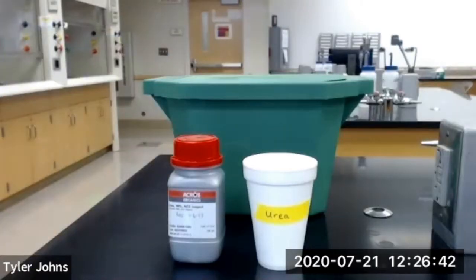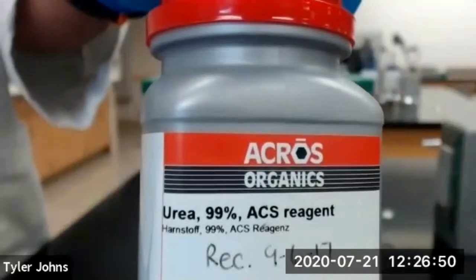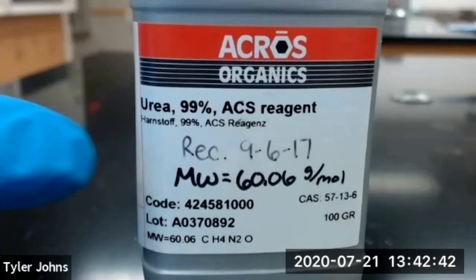Let's get started. For part A of this experiment, we're going to be confirming the nature of colligative properties. The first chemical we're going to be using is urea. The molecular weight of urea is 60.06 grams per mole.